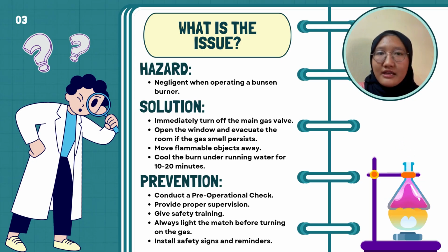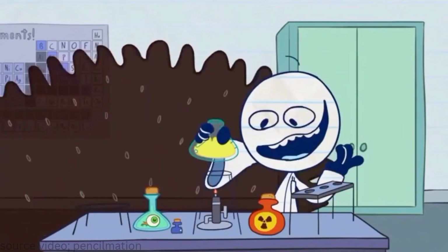And if someone gets a burn, cool the affected area under running water for 10 to 20 minutes to minimize skin damage. And how do we prevent it from happening again? We can conduct a pre-operational check, provide proper supervision such as a lab assistant or lecturer to guide the students, and give safety training before the lab. Always light the match before turning on the gas. And lastly, install safety signs and reminders so that students do not forget anything.